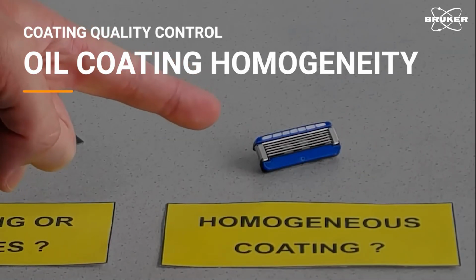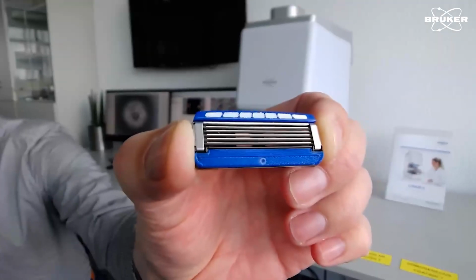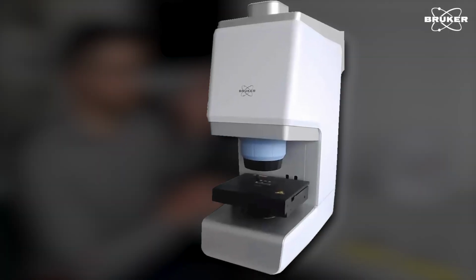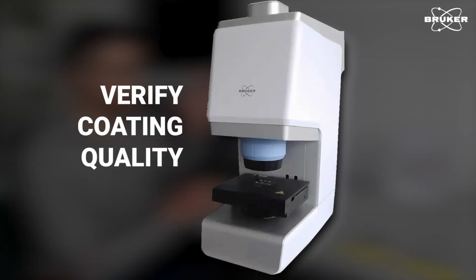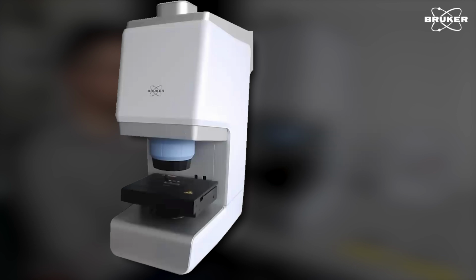The blades of this razor cartridge were given an oil coating to improve corrosion protection. But is the coating truly homogeneous? In this video, we will use the LUMOS II FTIR microscope to verify coating quality and demonstrate how quickly it can reveal irregularities on metal surfaces.